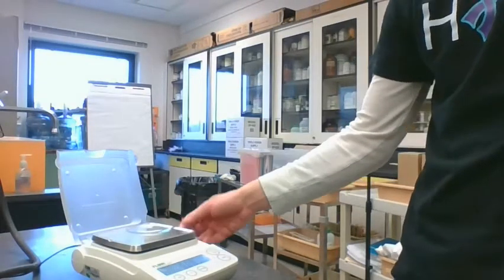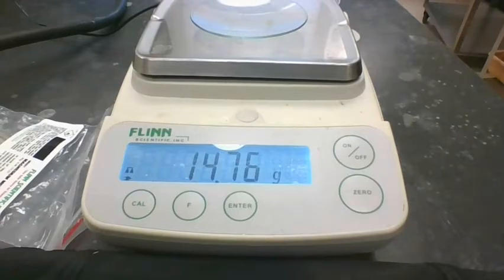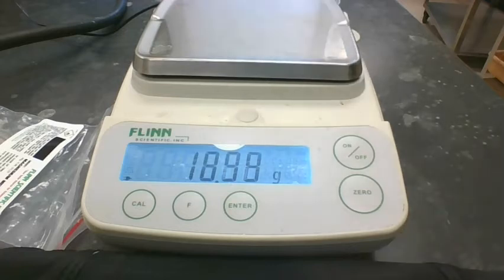We're just using that so we're going to put our piece of magnesium on that so it doesn't burn the table down or anything. So you need to just record the mass of the watch glass, which is 14.76 grams. That goes in the mass of an empty watch glass, 14.76.